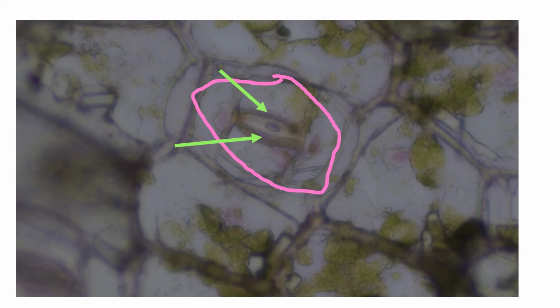I hushed that up. So anyway, those cells they're highlighting are guard cells, and they will actually allow the stomata to open or close. They facilitate the opening or closing, which allows gas exchange, which allows the plant to do photosynthesis with the intake of carbon dioxide, and then get rid of the oxygen made as a result of photosynthesis. And when they open or close, plants lose water, and that's transpiration. And that is the size of the vascular tissue.